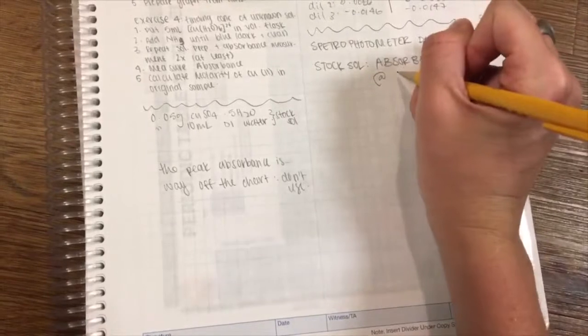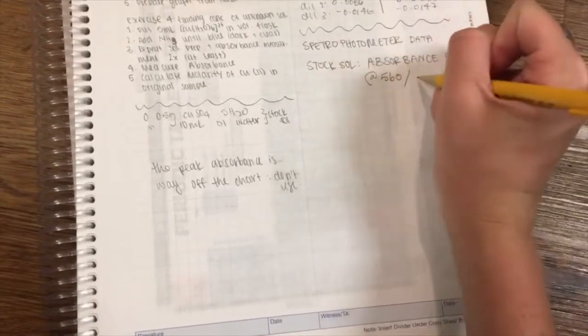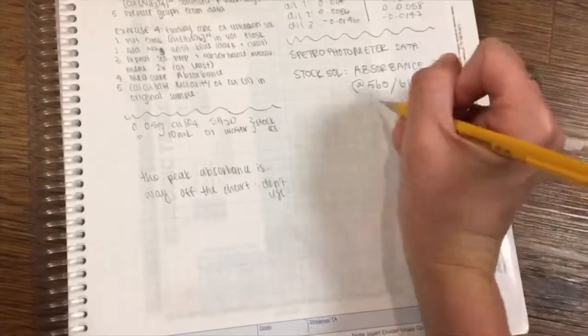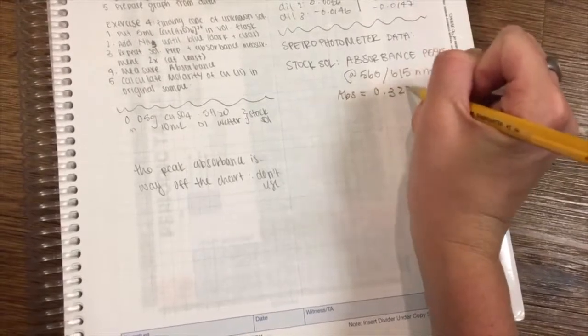We scan across all wavelengths as there are going to be different peaks. When we did our scan on the spectrophotometer, we saw many peaks, with the highest absorbance being off the screen. We chose both 560 nanometers, as that is what our TA told us, as well as 615, as that is what we measured from the spectrophotometer. These values were used as our lambda max, as it fit our data the best.